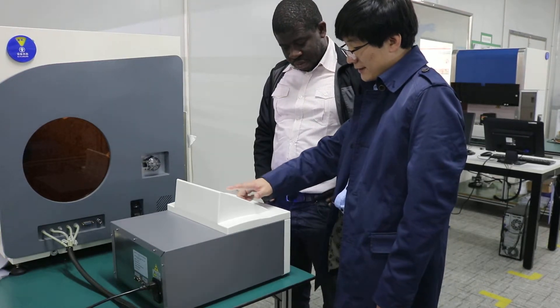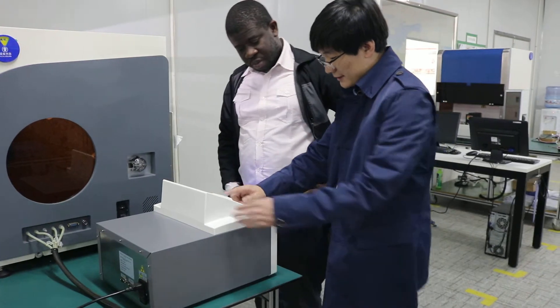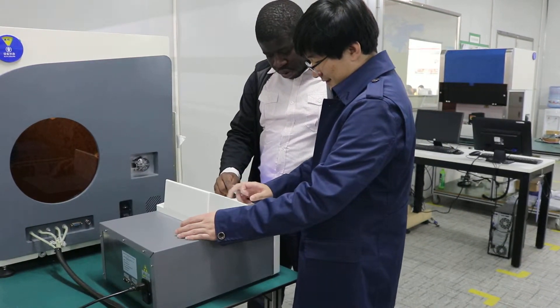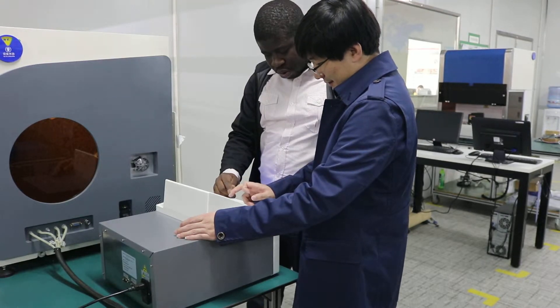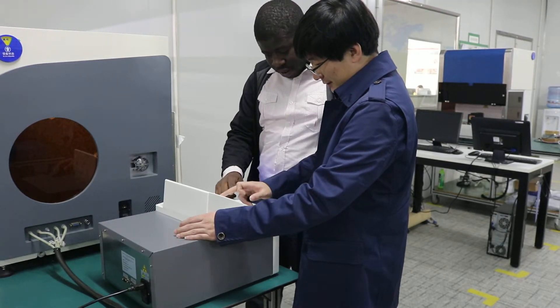This one, for example, is the first one. This is the next one.